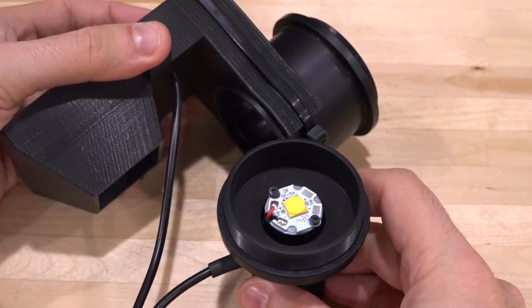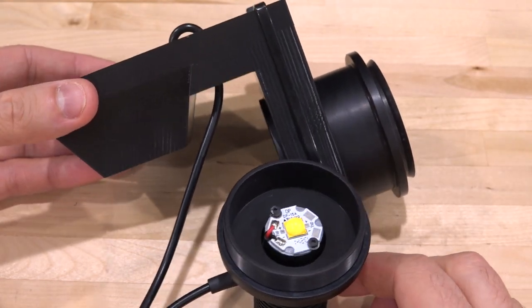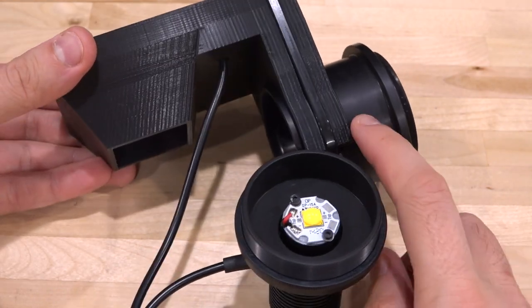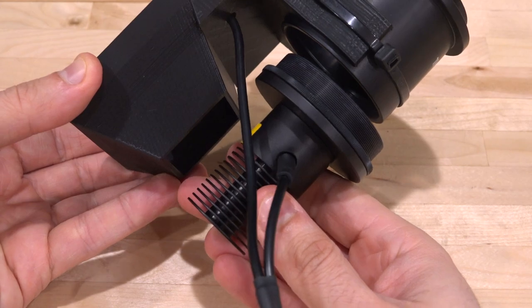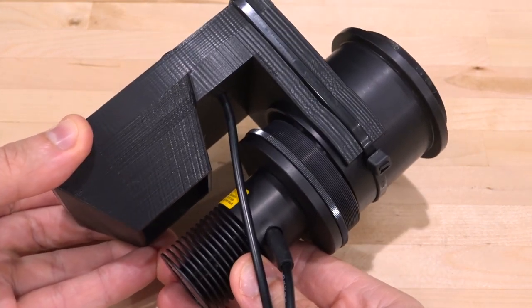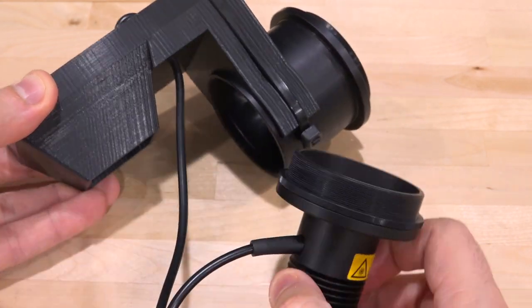But because the heating was getting too much, and the LED would then have a significantly reduced lifespan, my brother 3D printed this little piece over here, and that nicely clips onto this, and the fan over here blows right across the heatsink when you put it all together. So I think it's a really nice, elegant solution, because now you can just put this in the back of the microscope, and you can put 25 watts into this and get a tremendous amount of light from this.